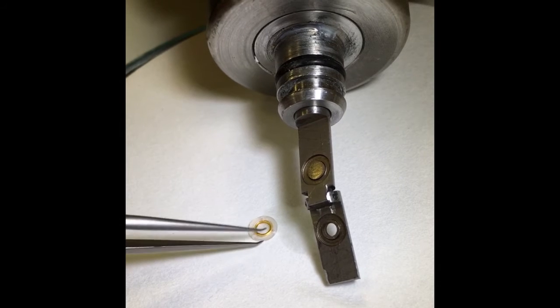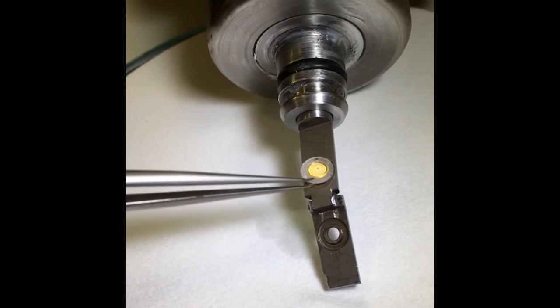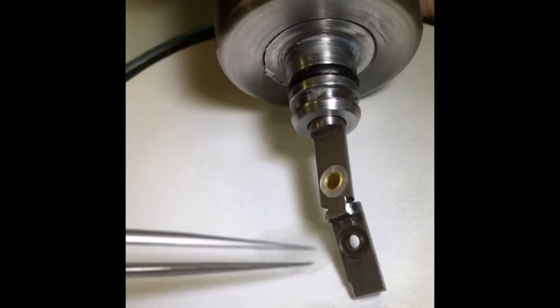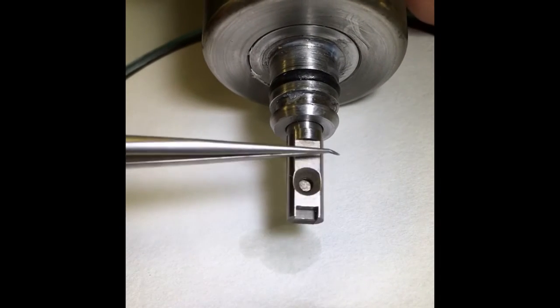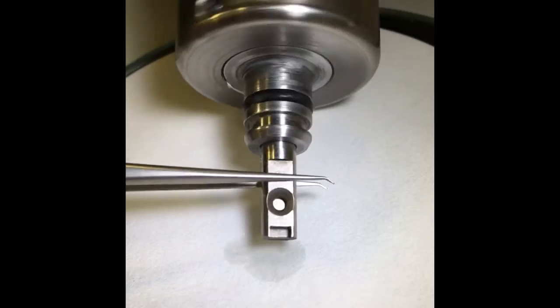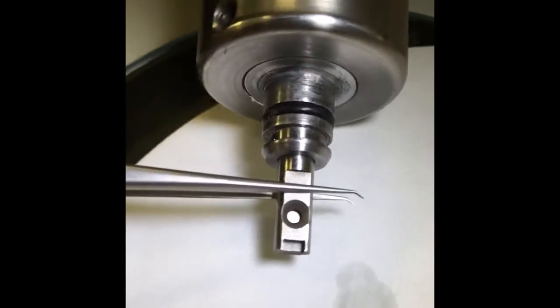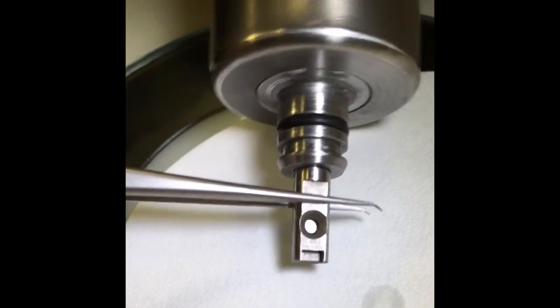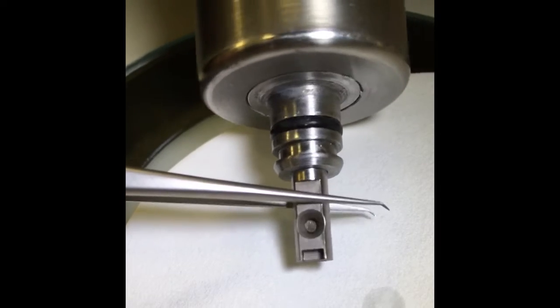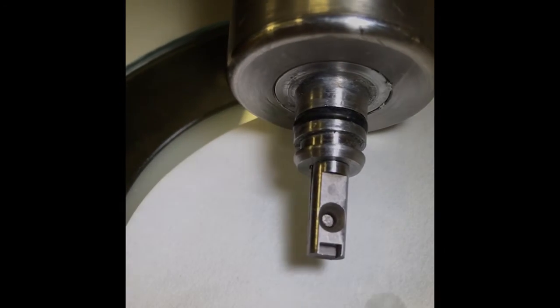So we take the capsule here and drop it inside the clamp, close the whole system, and then screw it all the way in. Now we're ready for imaging.